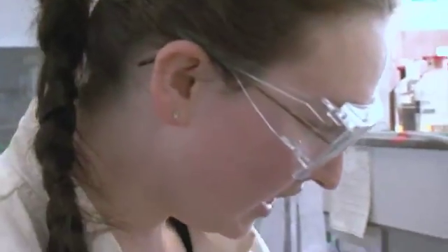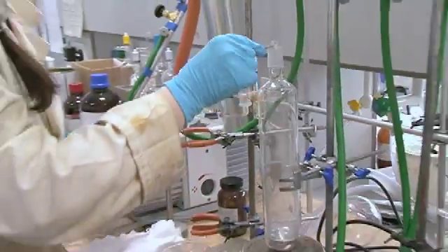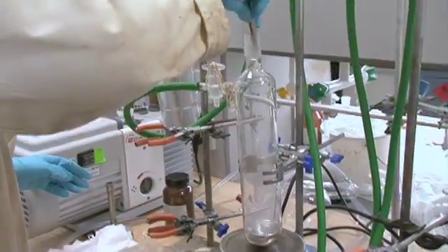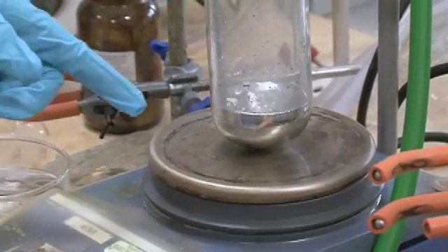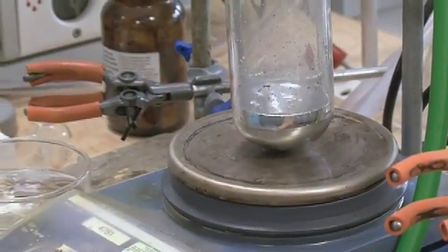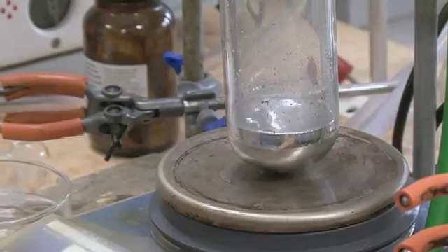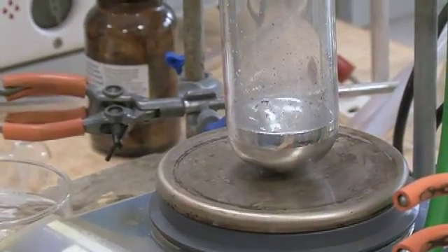That's quite cool. Oh, it's massive. The thing is that the more you get going in, the more concentrated it becomes, so the slower it goes in.